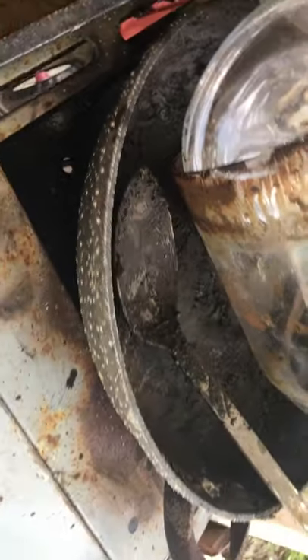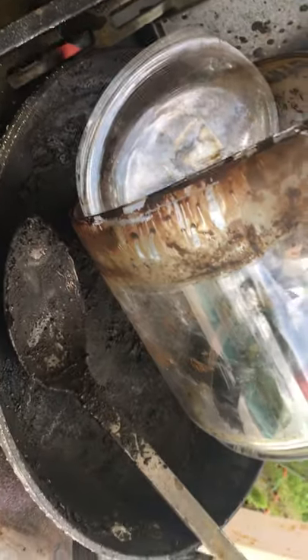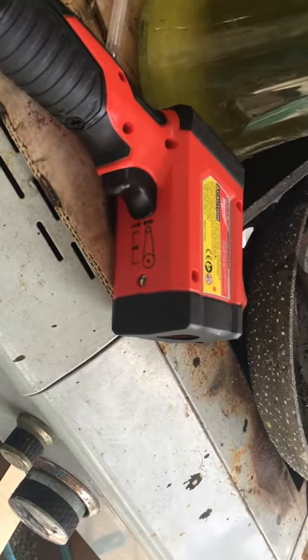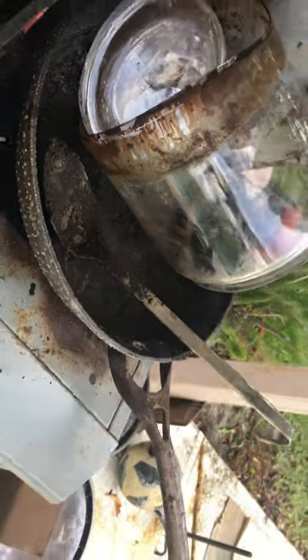This is where the silver mud was. I broke it when bringing to this pan to dry it, but I didn't lose almost any. Those bars — I lost control of the temperature using this one. This is where those silver bars came from.